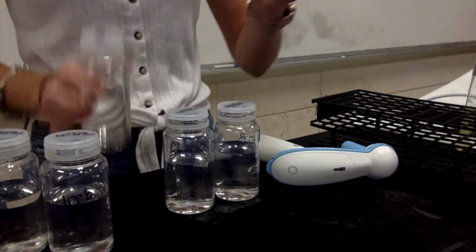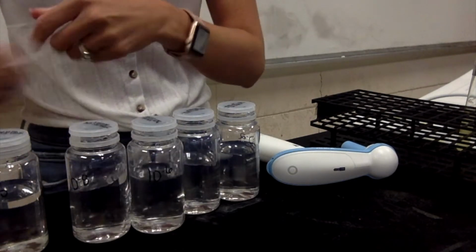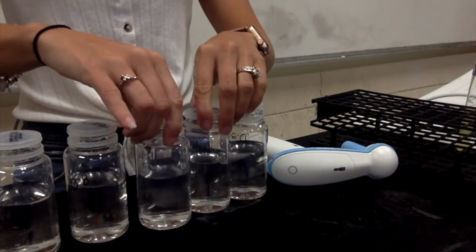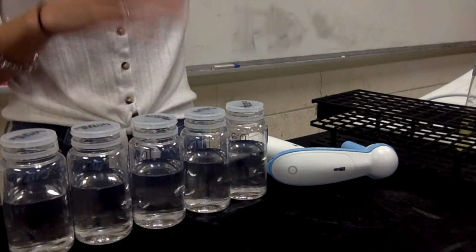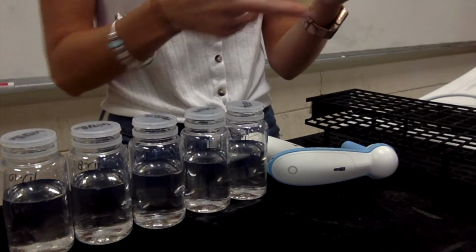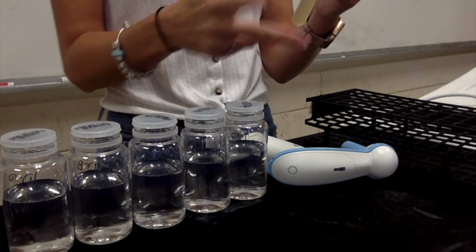You're not using the Bunsen burner for this or a loop or anything like that. You're using pipettes, and they are disposable. So once I'm finished with them, I'm going to put them in the biohazard. And you want to change out your pipettes with every dilution. You don't want to be mixing your dilutions. All right, so first, here's my E. coli. I'm going to give it a little bit of a stir because we want it to be evenly distributed. We don't want to have a whole bunch on the bottom and not a lot at the top.